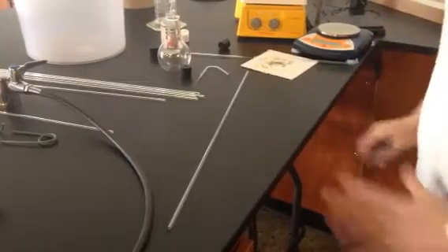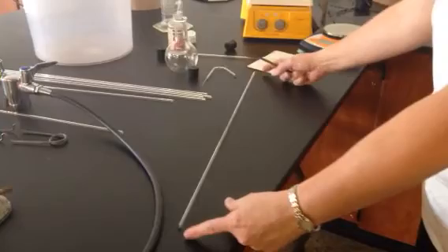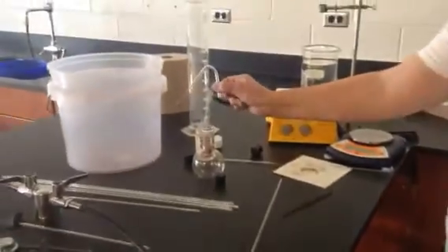Alright, today we're going to use some apparatus for the Volatile Liquid Lab. And you guys are going to have to make your own piece of glass. In the end, it's going to look like this.